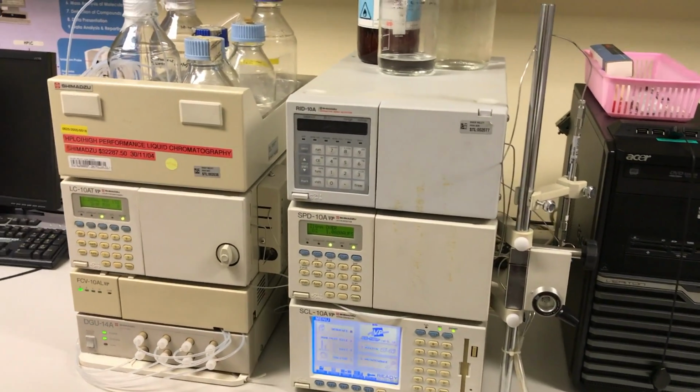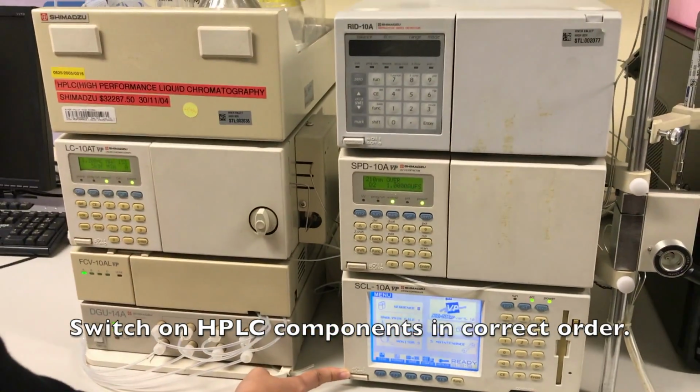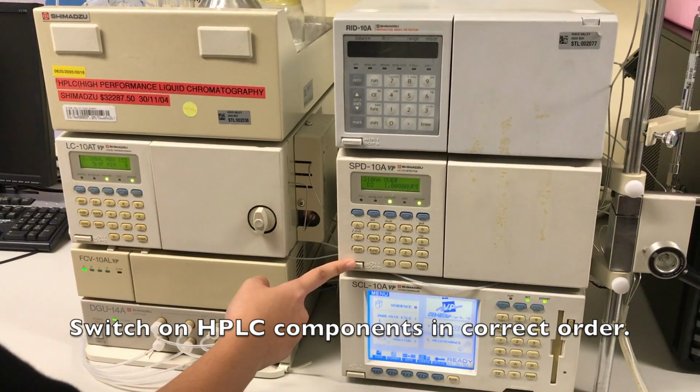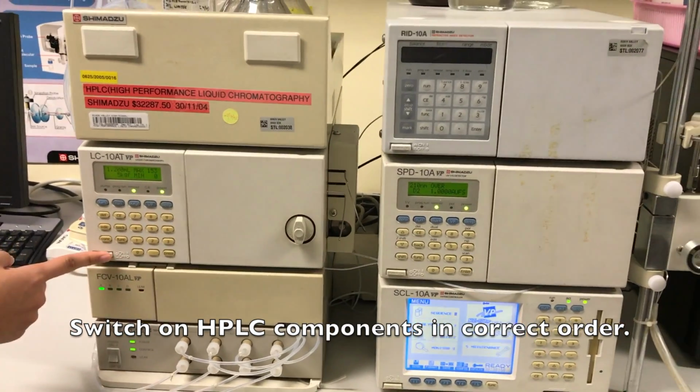Okay, so this is the HPLC machine. To switch on the machine, you have to turn on the button for the controller, then switch on the UV detector for organic compounds, turn on the degasser, and then turn on the pump.